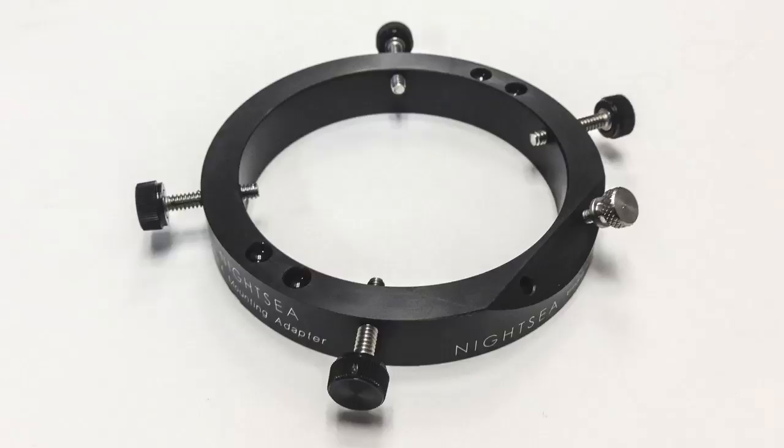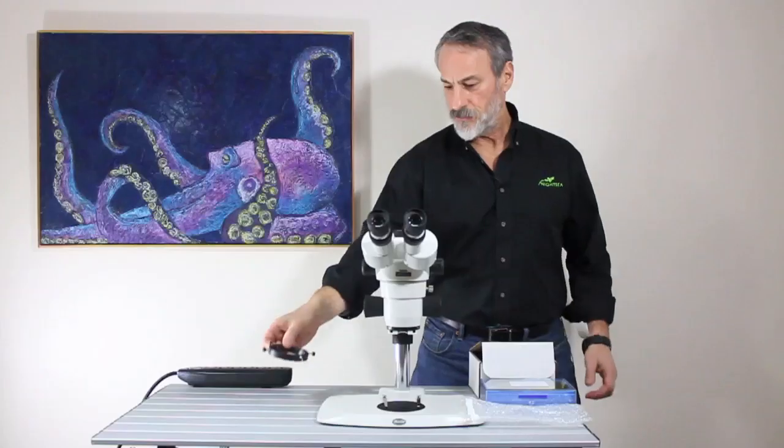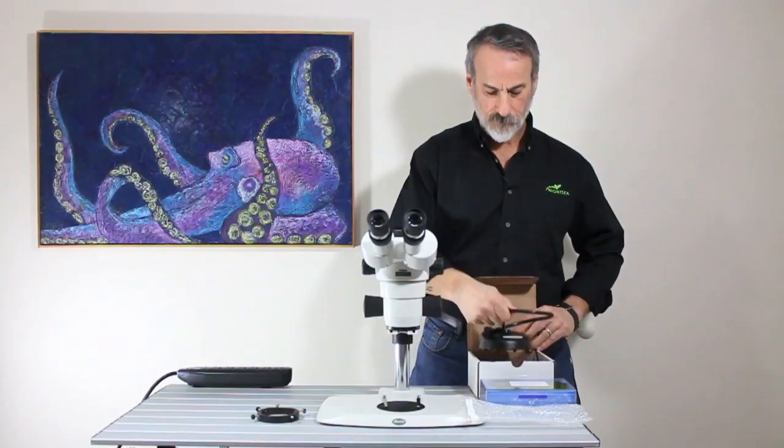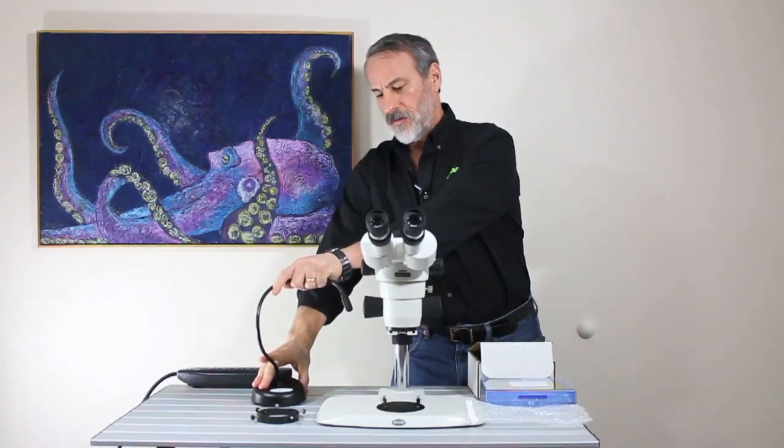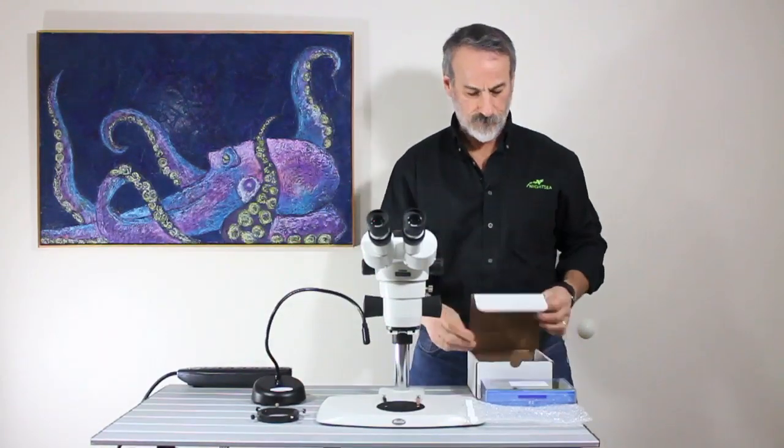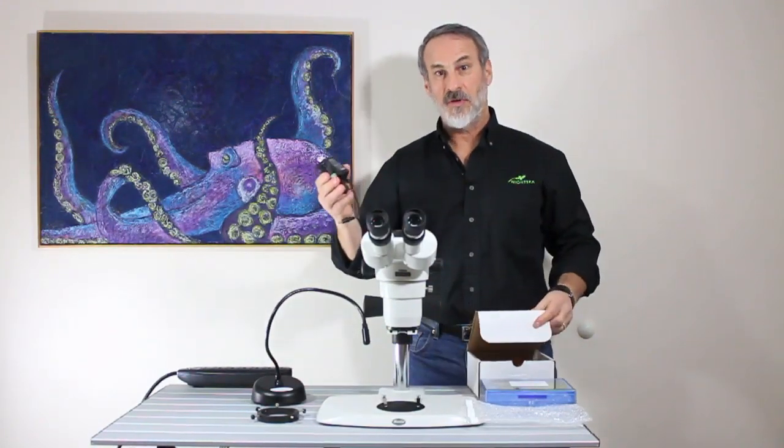This adapter ring is the only thing that is going to touch your microscope. It's a flexible gooseneck lamp base with a power supply.